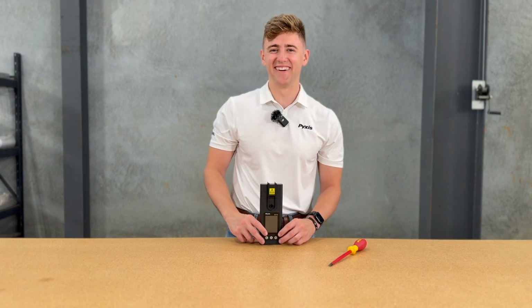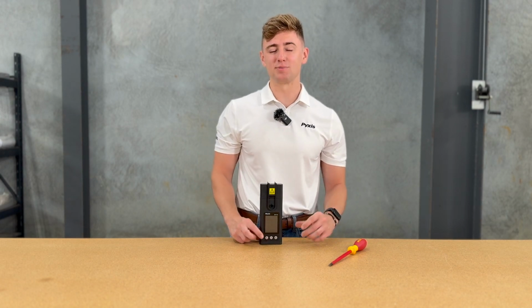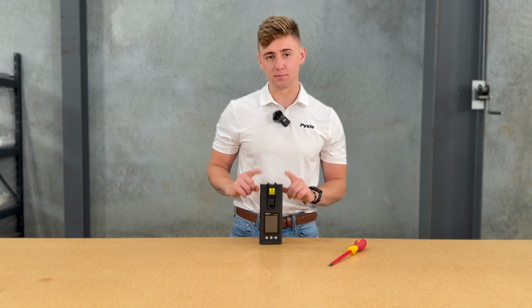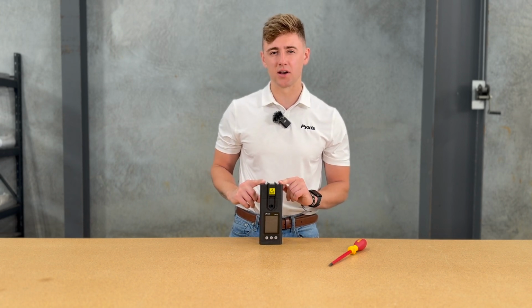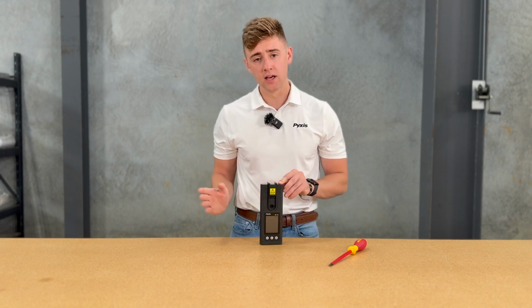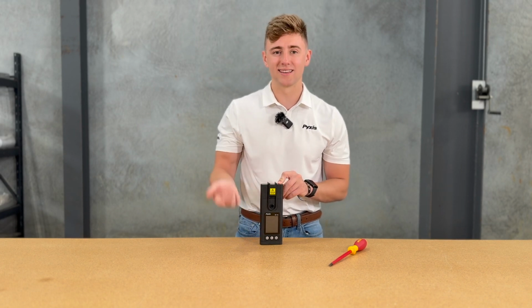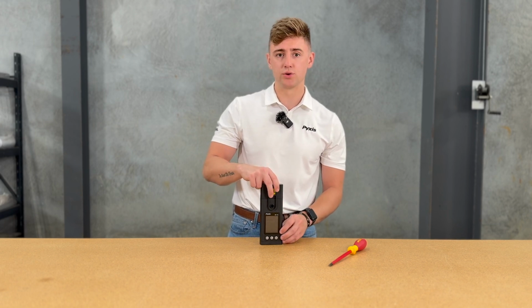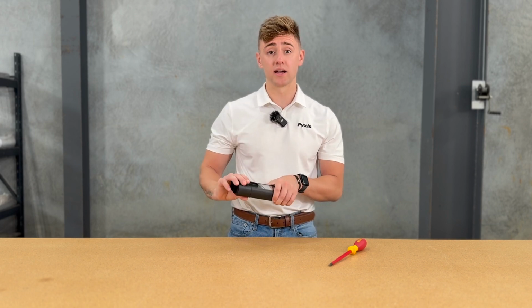Just kidding. I wanted to break down the SP710 handheld water multimeter, and in particular the pH ORP module, and show you guys how to successfully connect it via Bluetooth to the base of the device, as well as exchange the battery of this pH ORP module to give it a little bit more juice and make sure that it has a longer life for you guys out in the field.